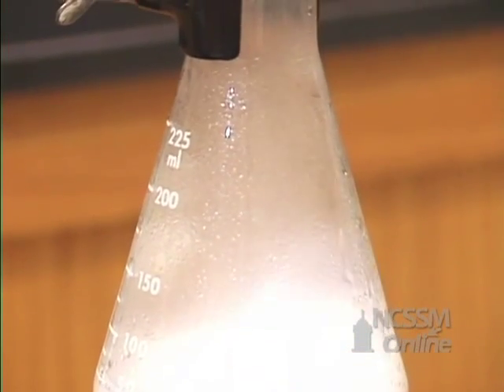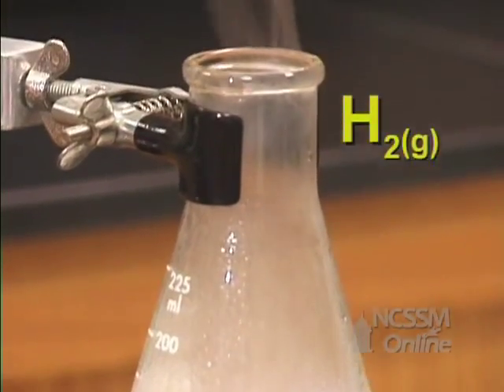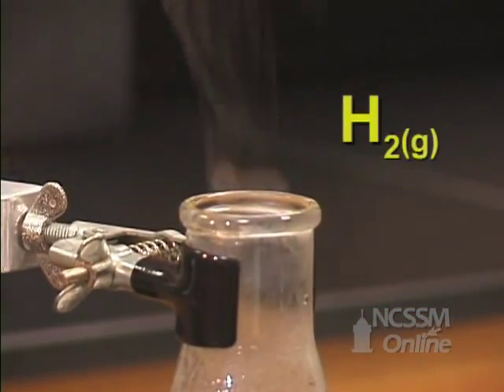The hydrogen gas can be tested for by using a burning splint. The hydrogen gas is flammable and ignites.